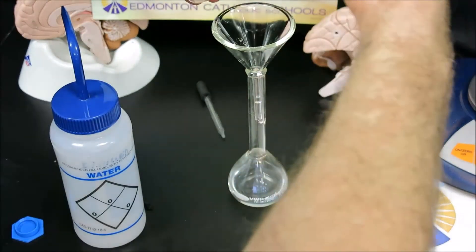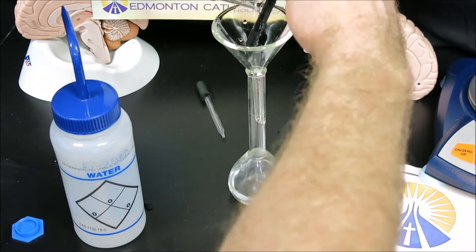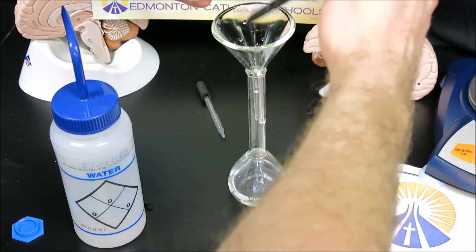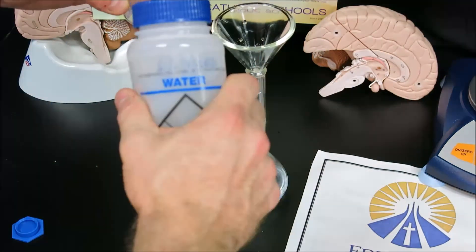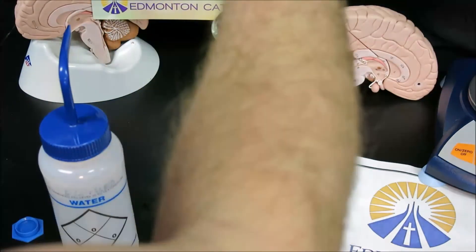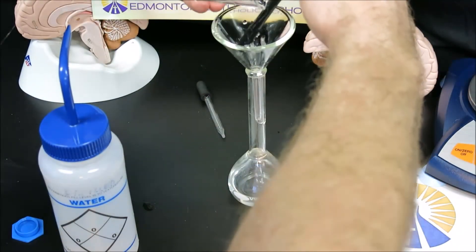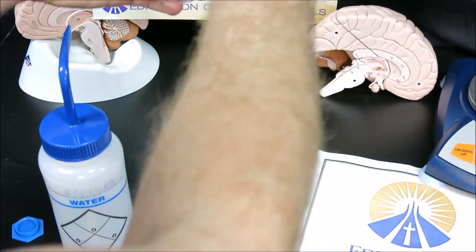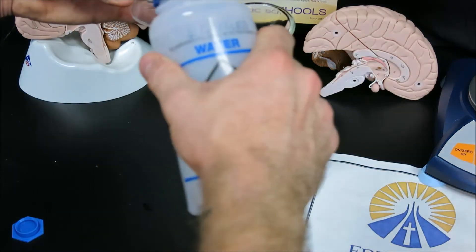Every time I rinse, I'm rinsing the stir rod and the funnel as well as the beaker. Getting all the sides of the beaker. Our last clear rinse.